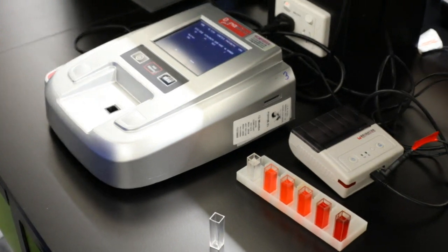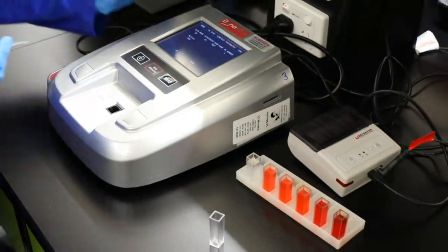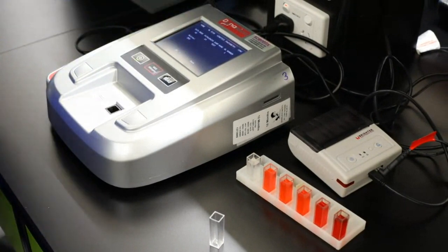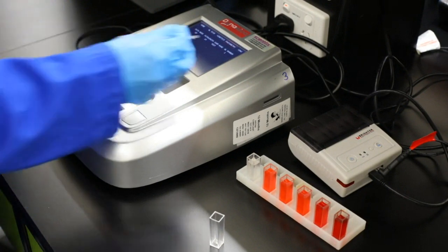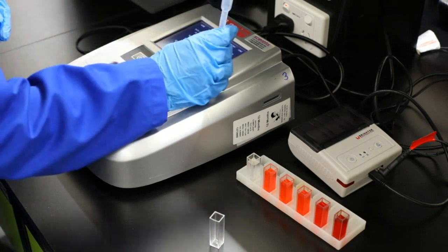It is green. So for us, we need to set this up and have it at 550 nanometers. So green is a bit of a range there from about 450 to just over 550. So for our colours, we're just going to be using this. I'm only going to be using one wavelength. So it's all pretty sweet now.